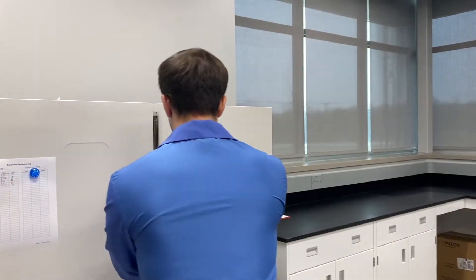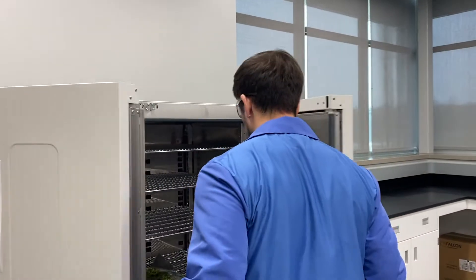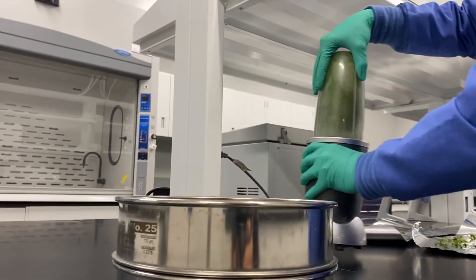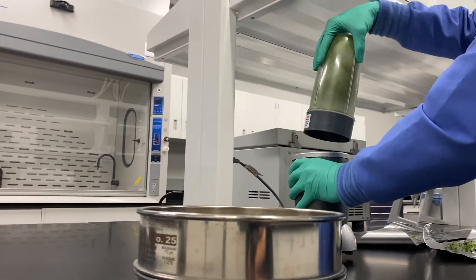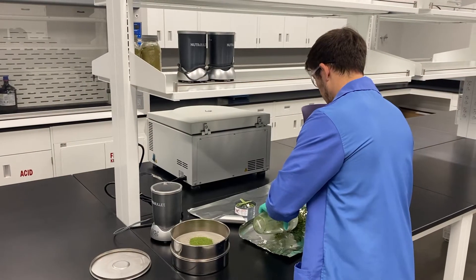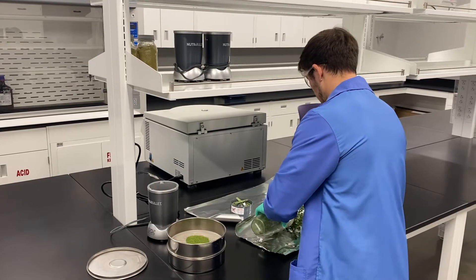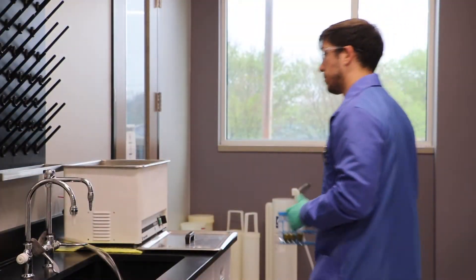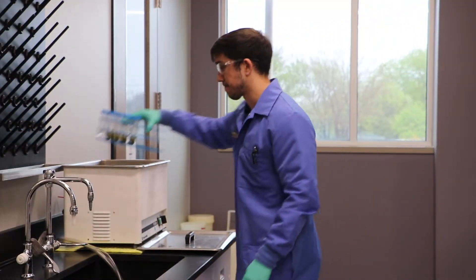We use a drying oven to remove moisture, then the samples are ground so we have a homogeneous specimen. Solvent is added to the ground material followed by sonication.